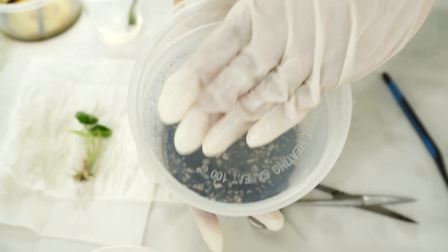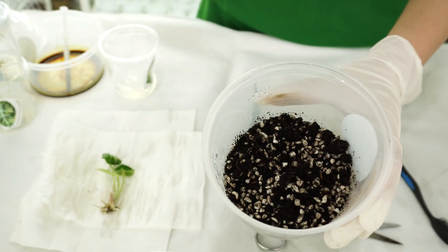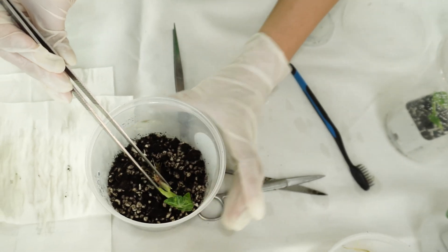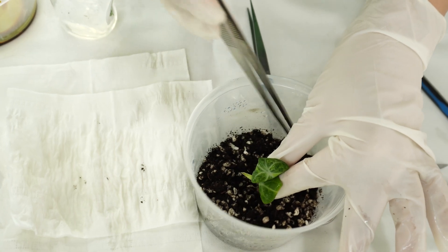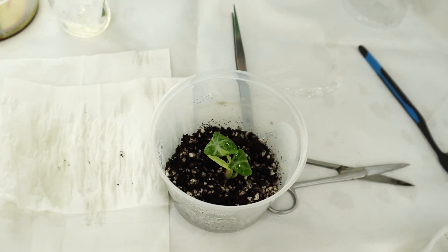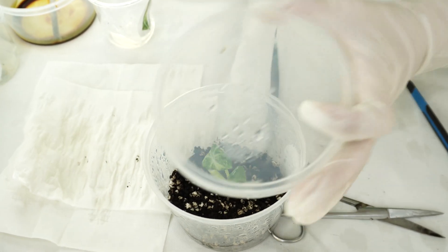You can see we use a different kind of container here — for this one, you can acclimatize many plants in it. We normally do about five plants, maybe ten if the plants are not too big. However, for plants that grow fast and tall, the dome plastic container might be even more suitable.